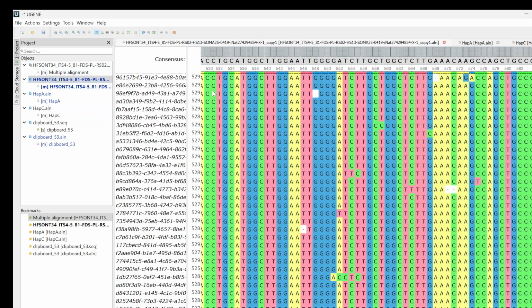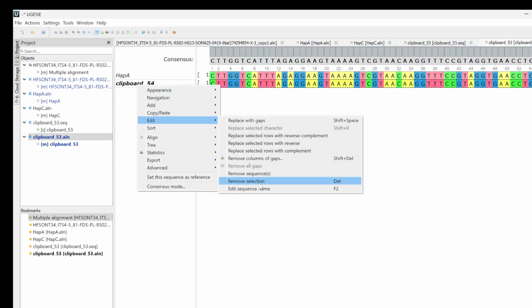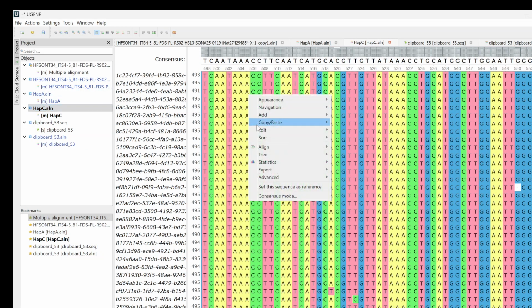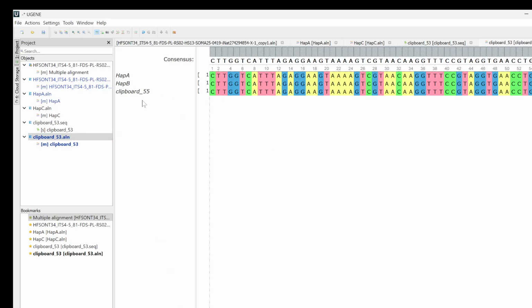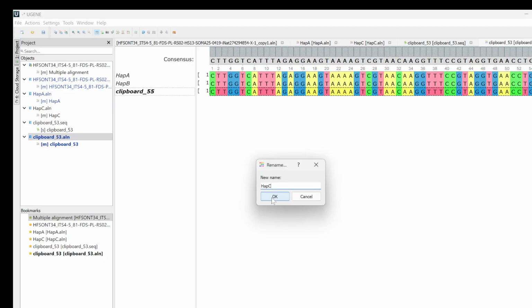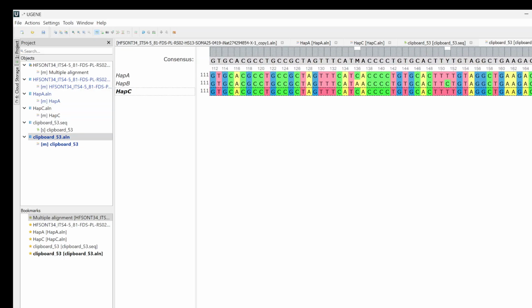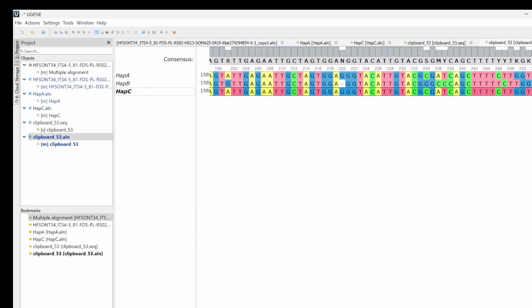Okay, now we'll do this one, which is our haplotype B. Remember, don't do consensus with gaps. We don't want the gaps. And we'll do hap C as well. Cool, so now we got all of our different haplotypes. We can align them with MAFFT. And then we can kind of see the variation between them. And we can also get our main consensus sequence.